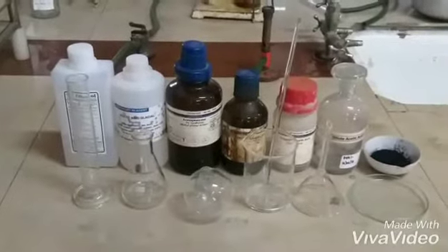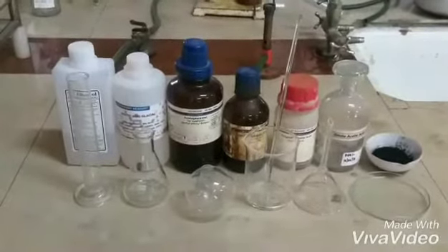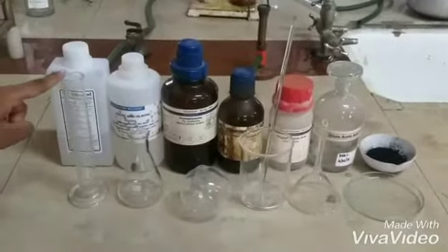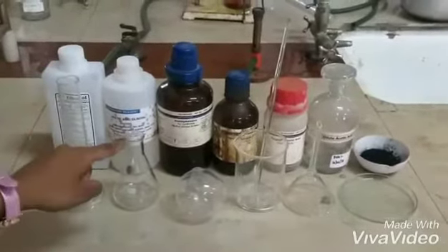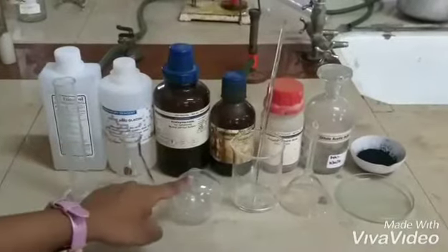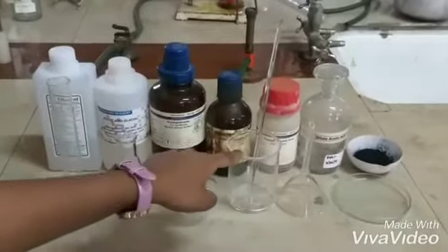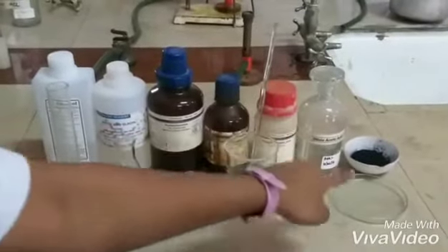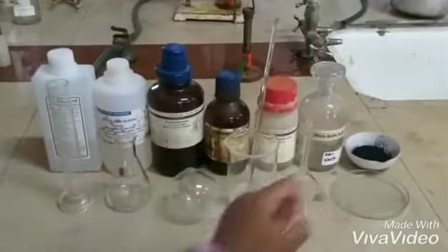Let's see the requirements for synthesis. The required apparatus are measuring cylinder, conical flask, RBF, beaker, stirrer, funnel, and petri dish.